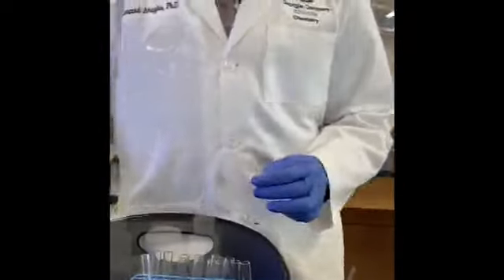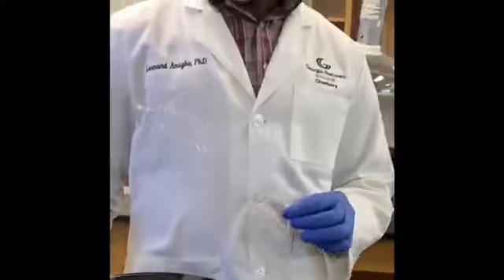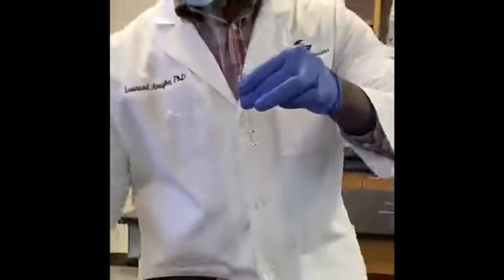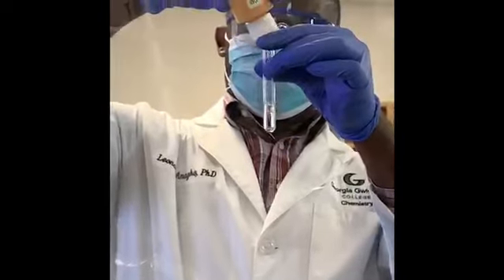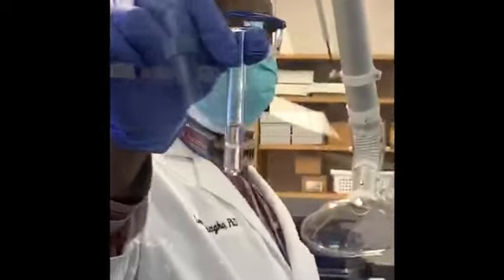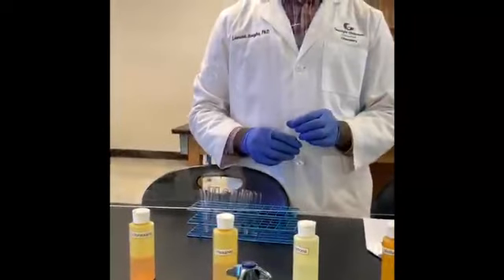Let's get to the next. Our next will be a mixture of H2O and cyclohexane. So let me begin with H2O. Then I'm going to add in cyclohexane. It's a cyclohexane. And shake it and observe. Alright, so we will continue.